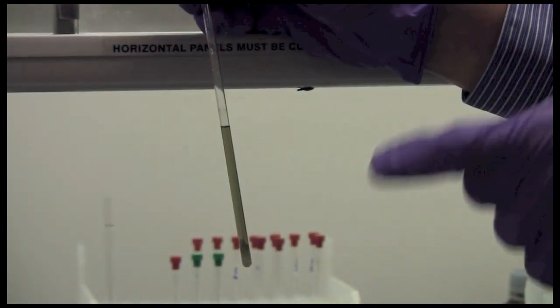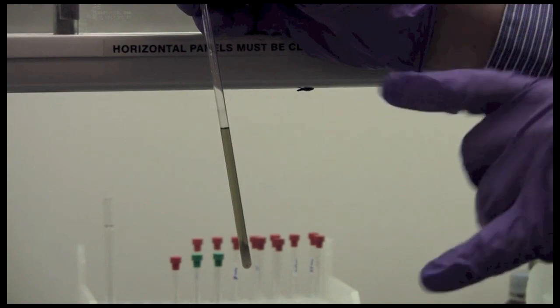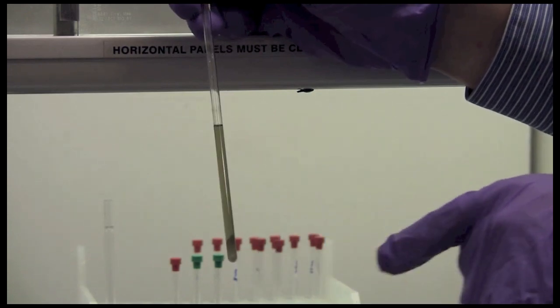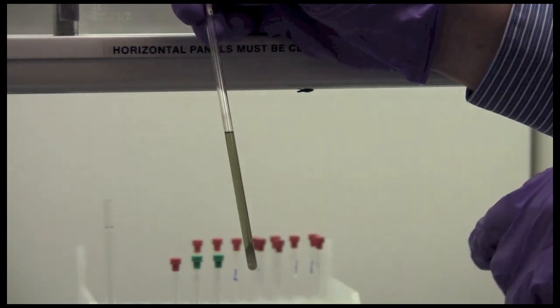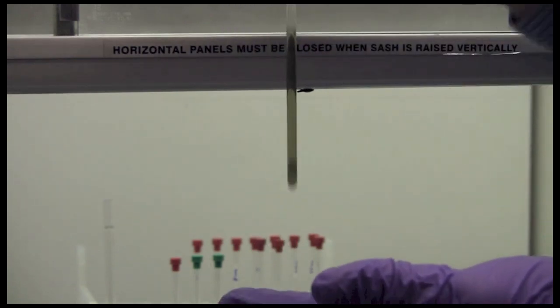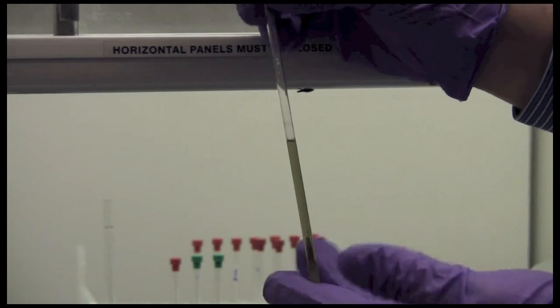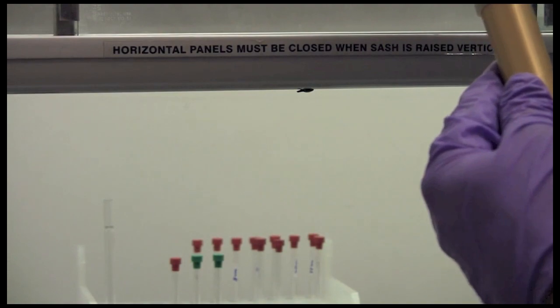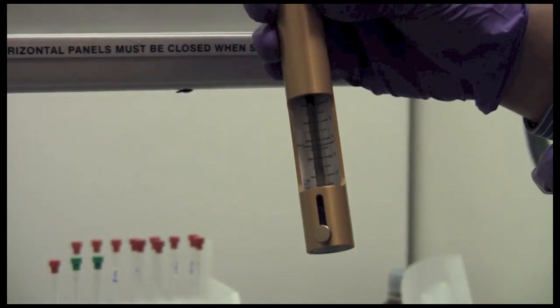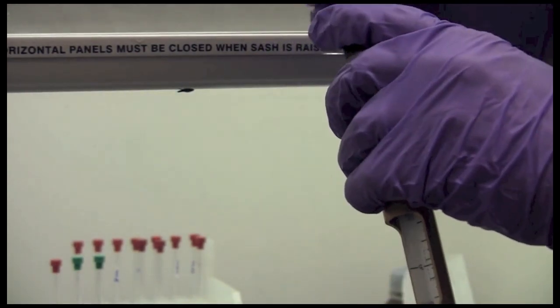Sample like this has precipitate in it and is far too long. It is likely due to somebody preparing their sample inside of the NMR tube. This again is going to give very poor quality data unless you are able to push the tube far enough down to get this material outside of the region that is being detected. However, if you put the tube too far down what will happen is that it will hit the bottom of the probe inside the magnet and could break your tube and cause a problem. So never set your tube below the maximum depth indicated on the depth gauge. Because if it goes too far down it could break as it enters the instrument.